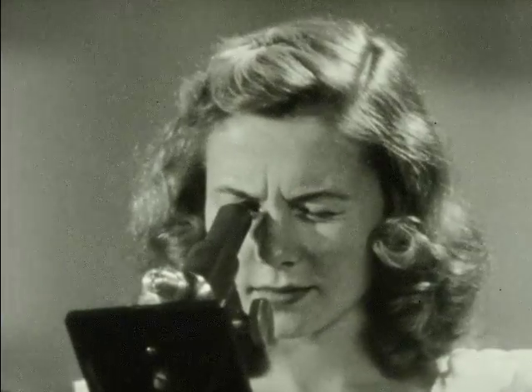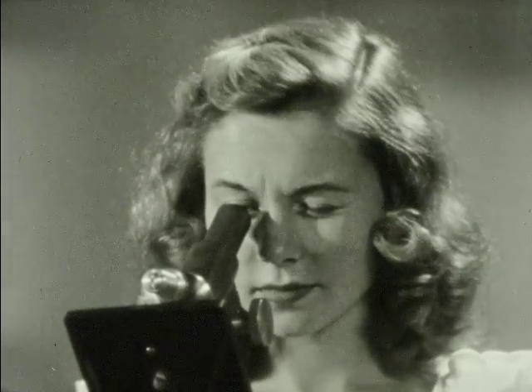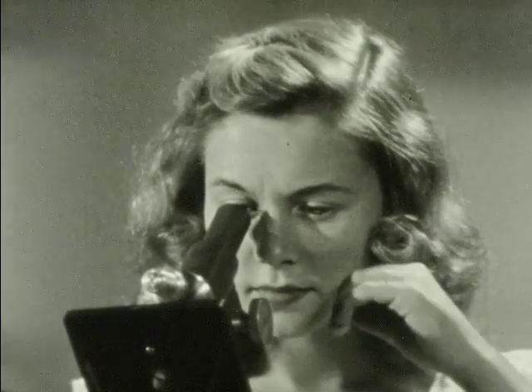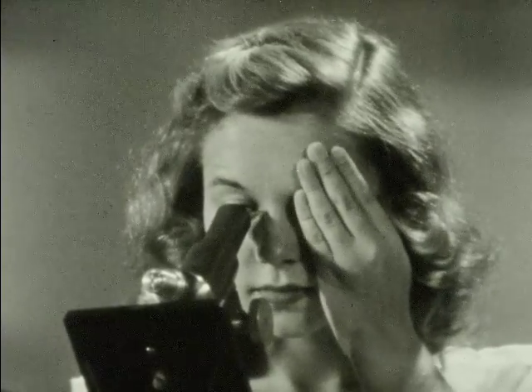A person trained in the use of the microscope learns to keep both eyes open while viewing the specimen. This helps avoid eye strain and makes the work less tiring. You can learn this technique too. Now, don't squint. Try leaving both eyes open and covering one eye with your hand. Concentrate on the view through the microscope.